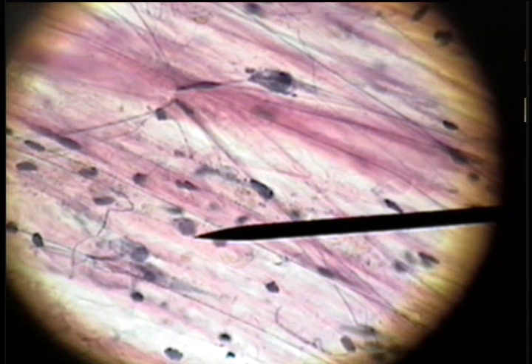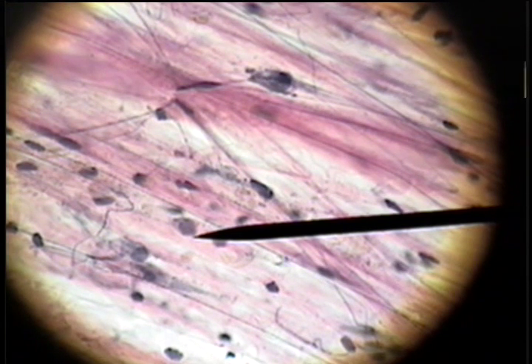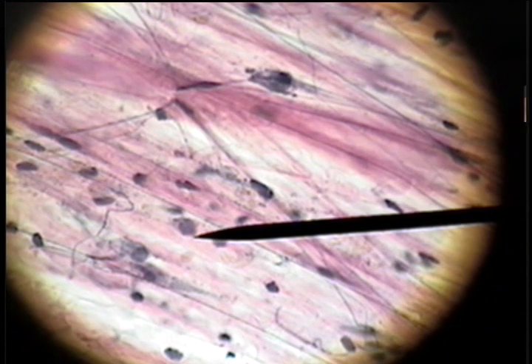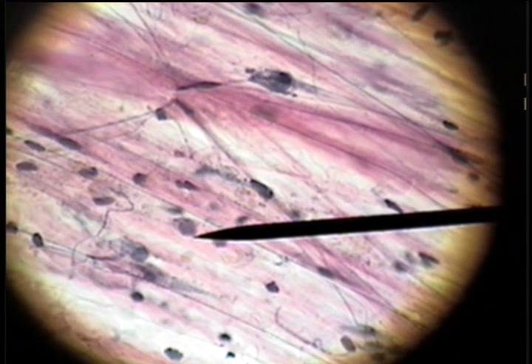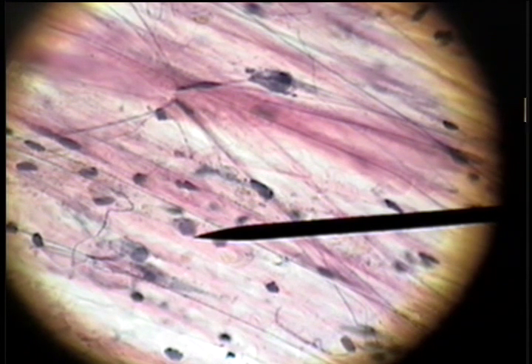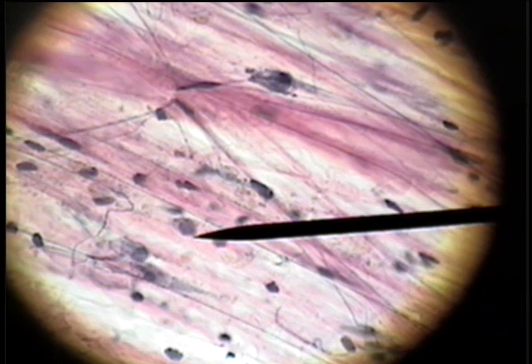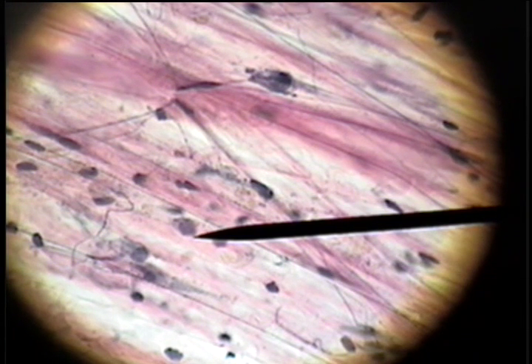This loose areolar connective tissue is found surrounding blood vessels, under the skin, and around neurovascular bundles — bundles of nerves and arteries.